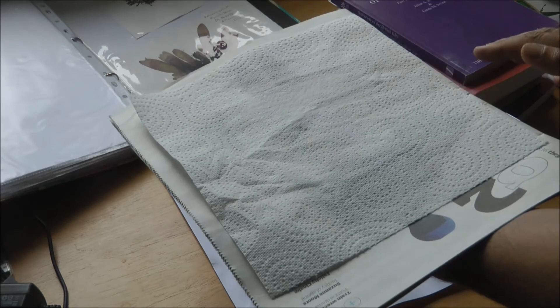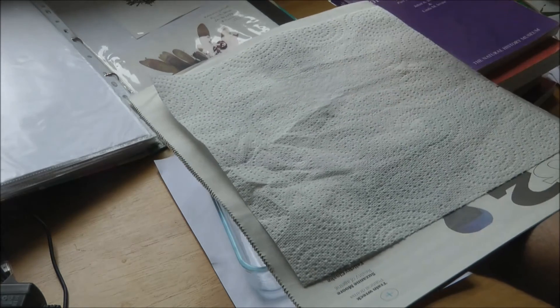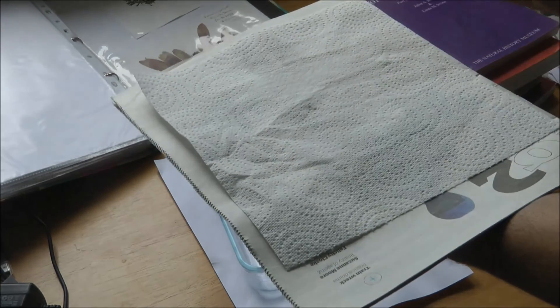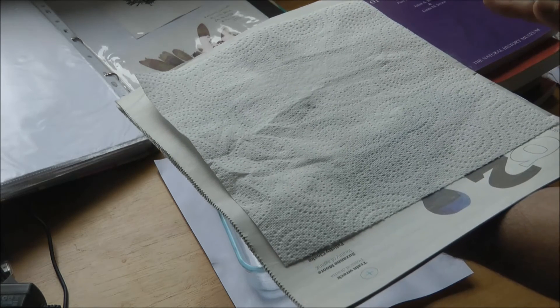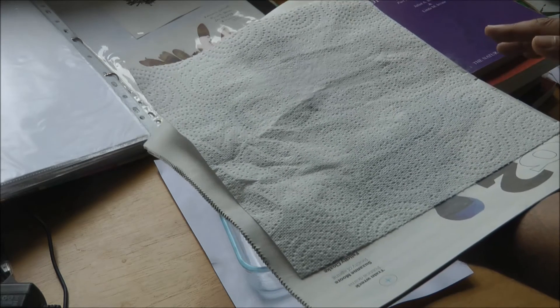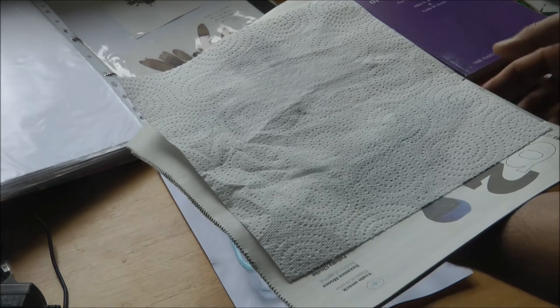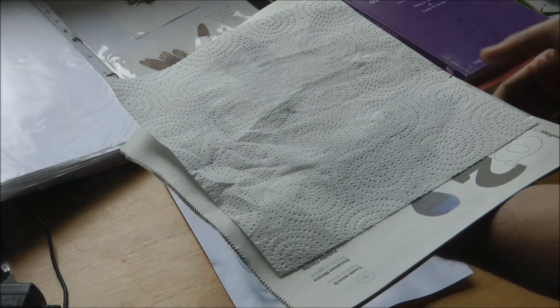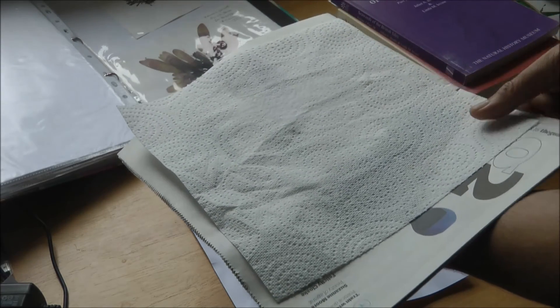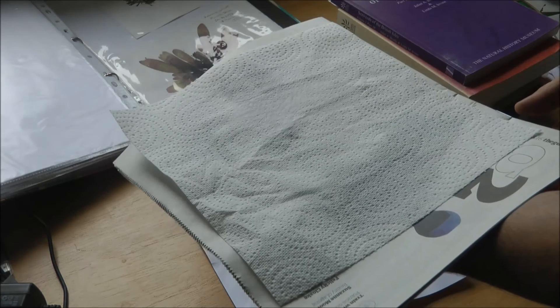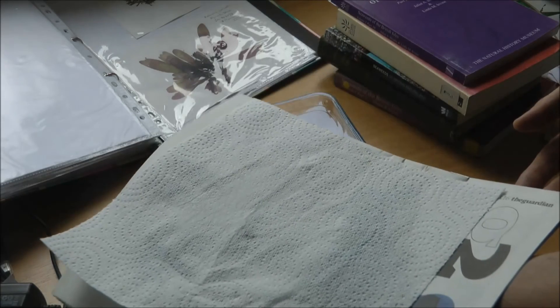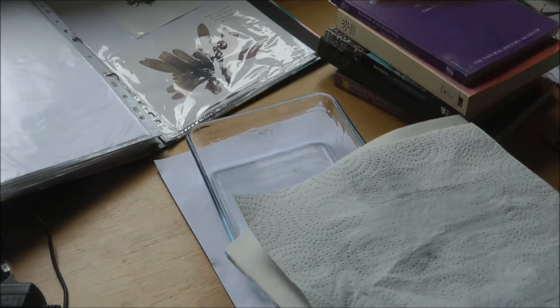It's a good idea to maybe change the newspaper and the kitchen roll after a day, or at least just check that it's soaked up enough water so it can dry off a bit. And that's it. It should be ready and dry in a few days and nice and flat, and then you can put it in your collection.